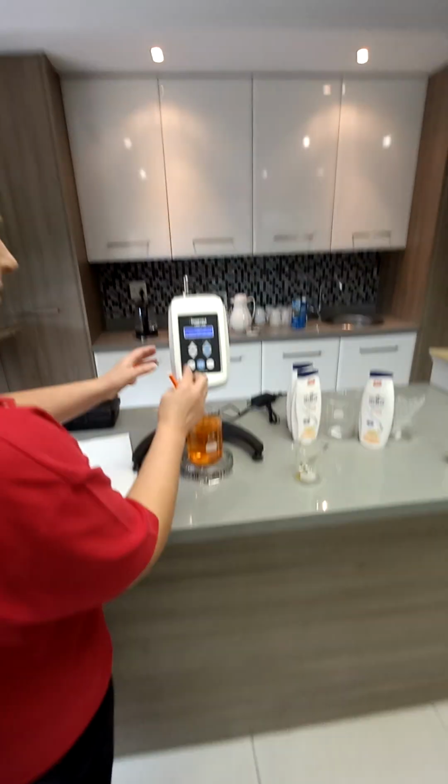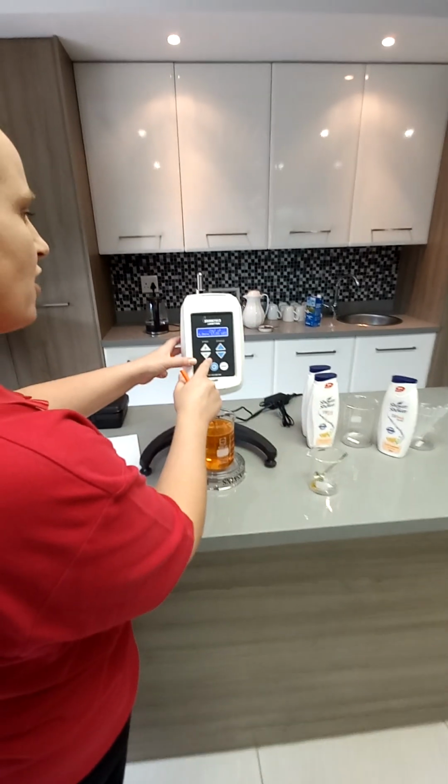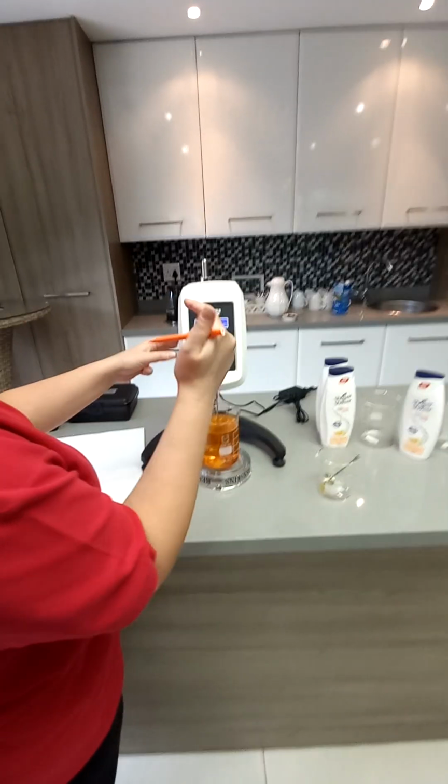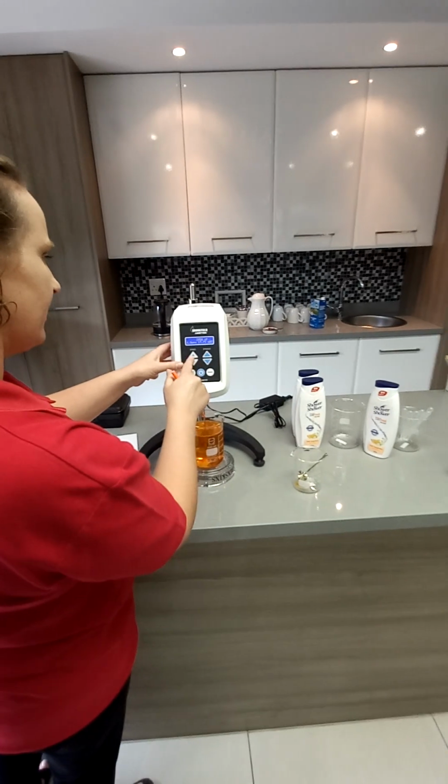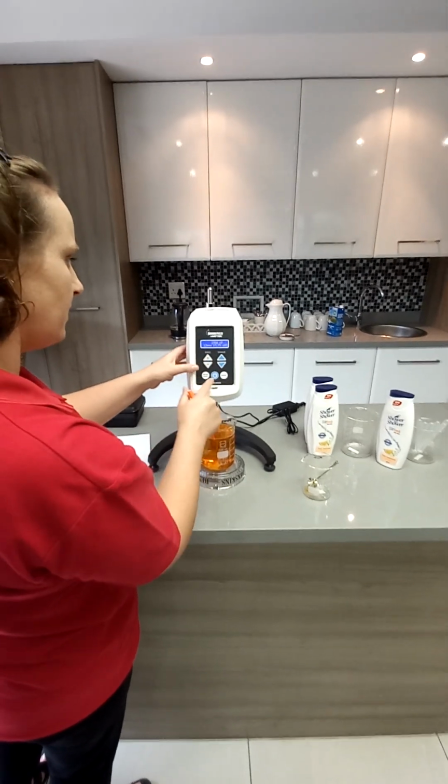That spindle just hardly moves, eh? It's crazy, like an optical illusion. Also, when you do tests, it's better to do it at 20 RPM and above.